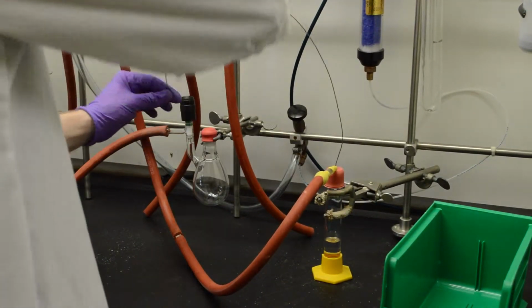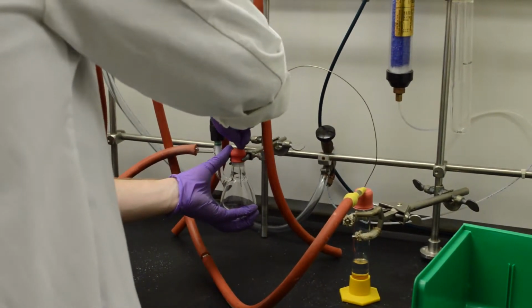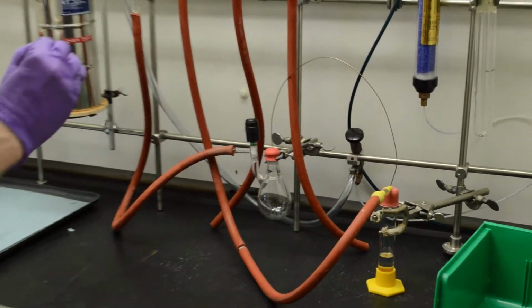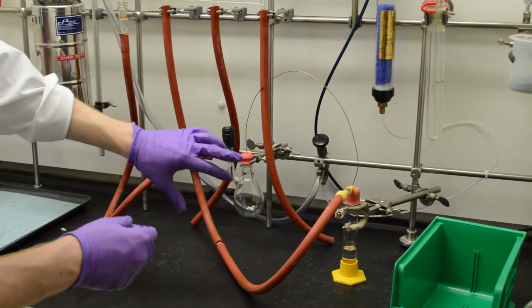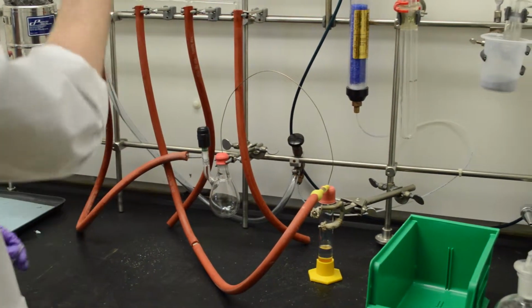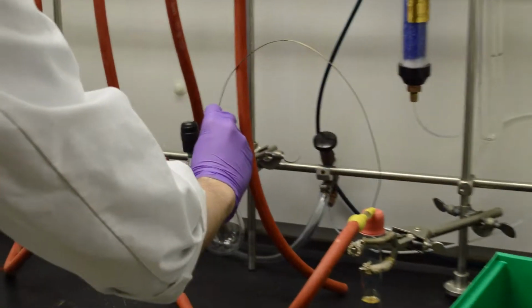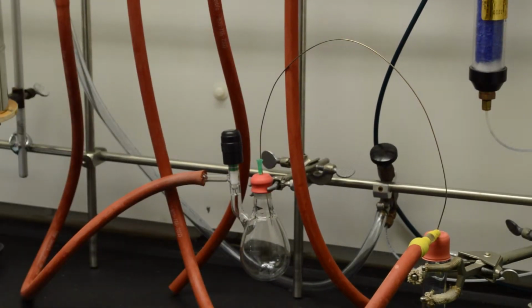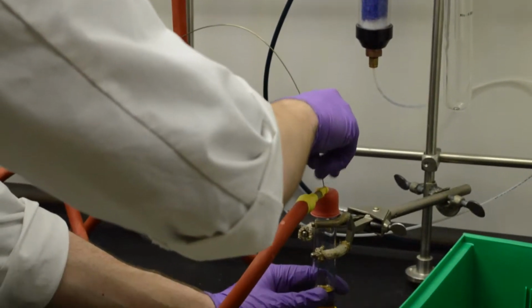So we can insert that into each of these two. And next we need to use this small needle here. This just provides an outlet in this one so that while nitrogen in solution is blowing through, it has a place to go. So we want to check the insides of these to make sure that they're clear. Have no obstructions in them. So once this is set up, we can slide this end of the cannula down underneath this solution.